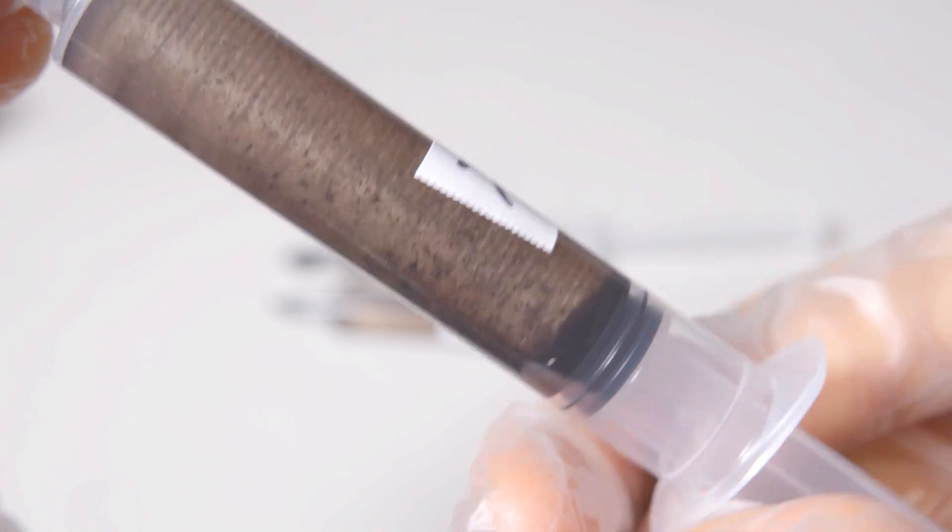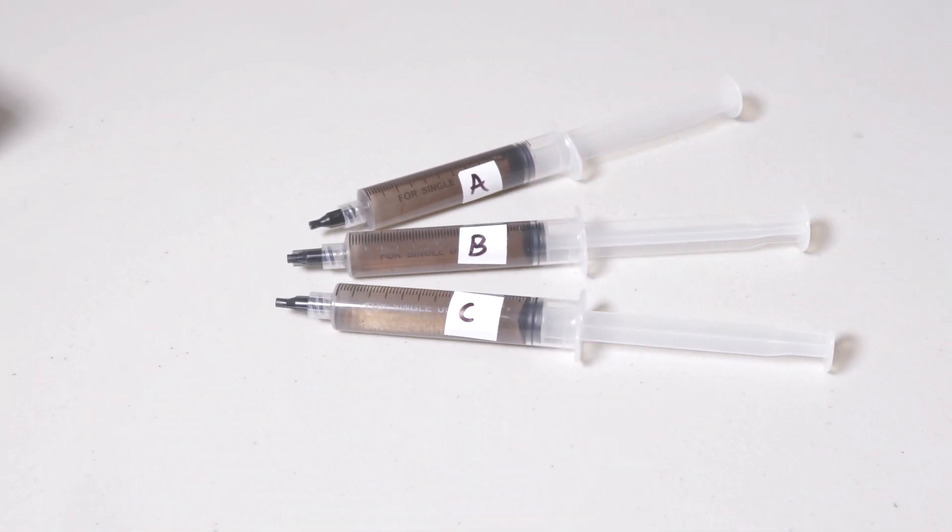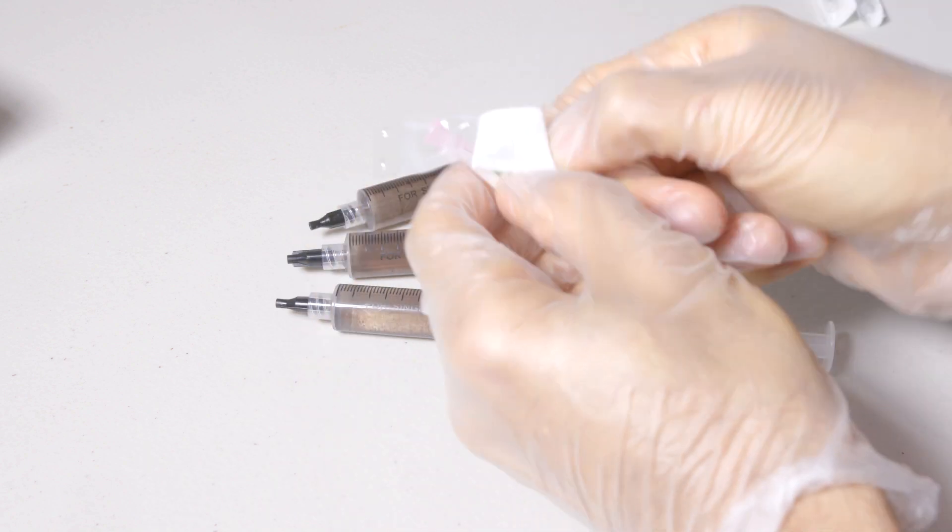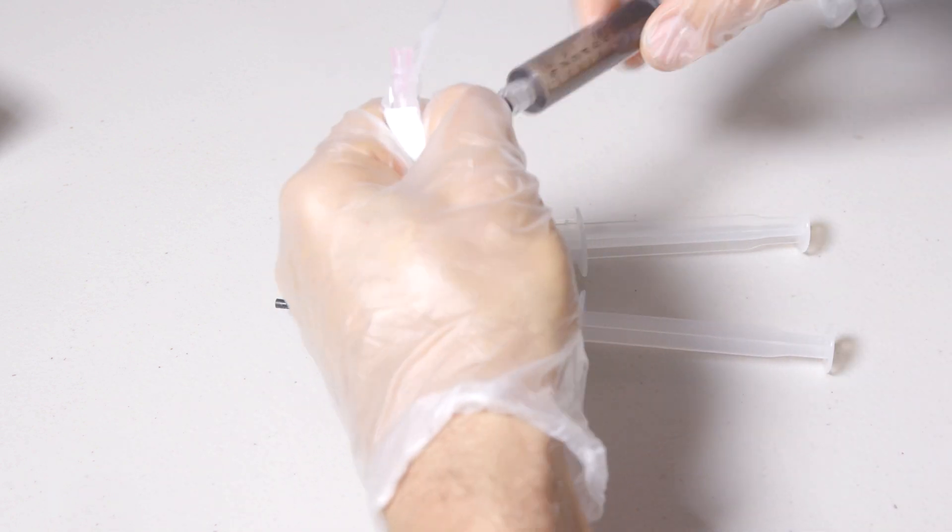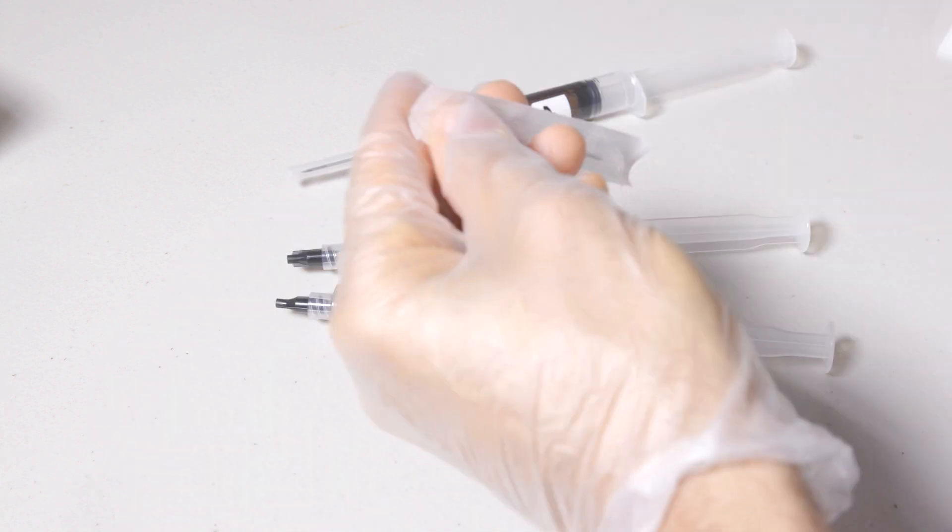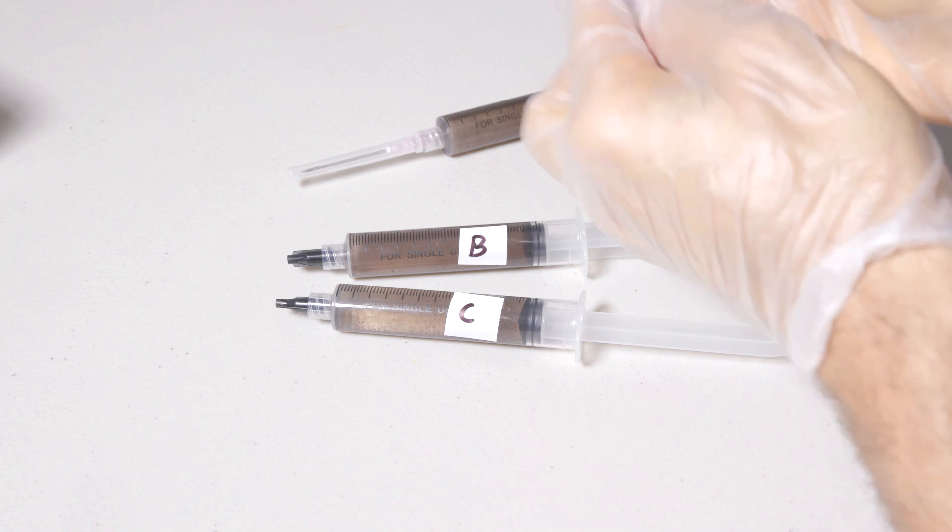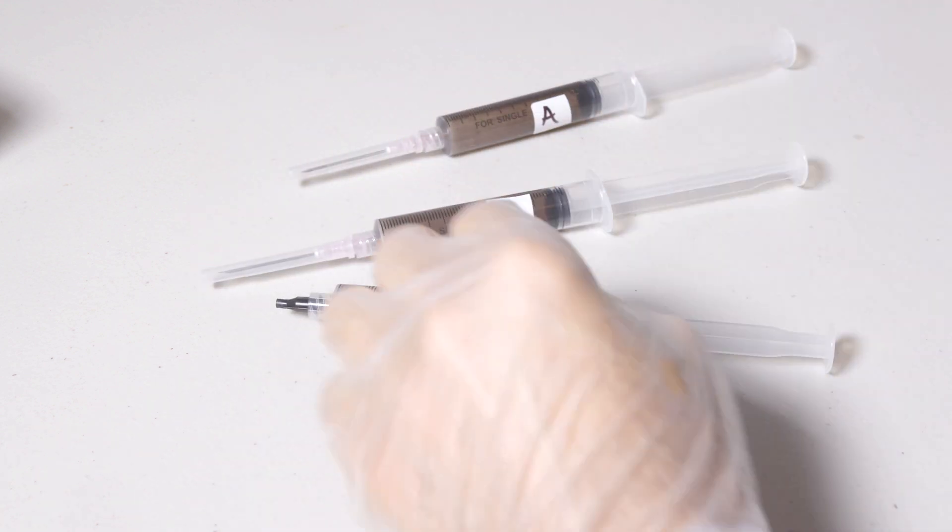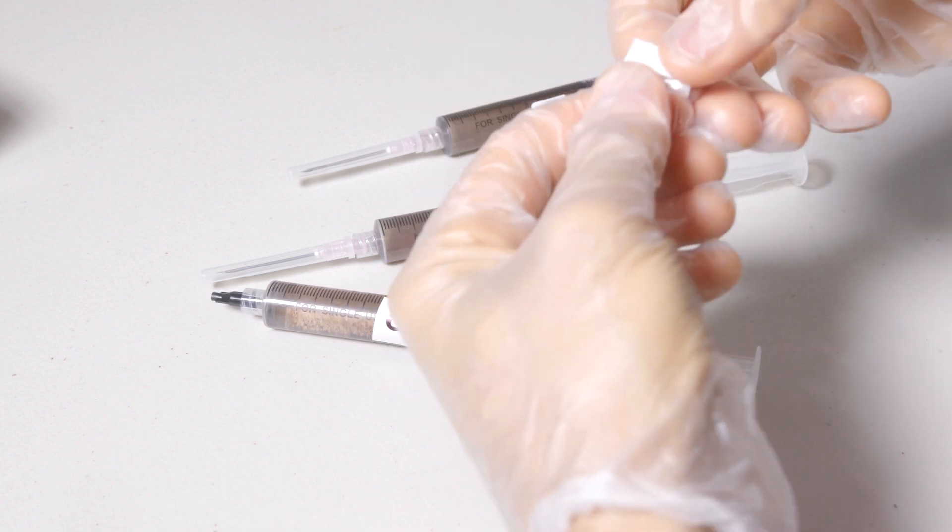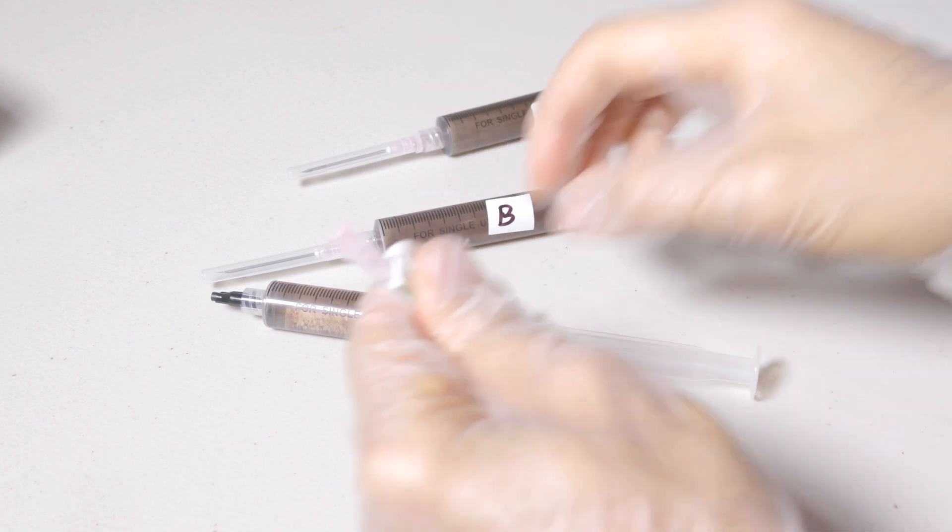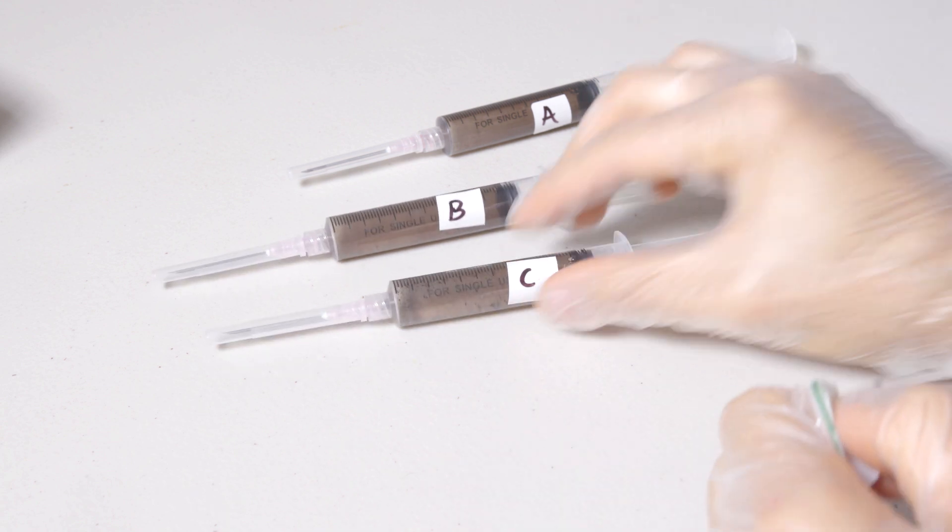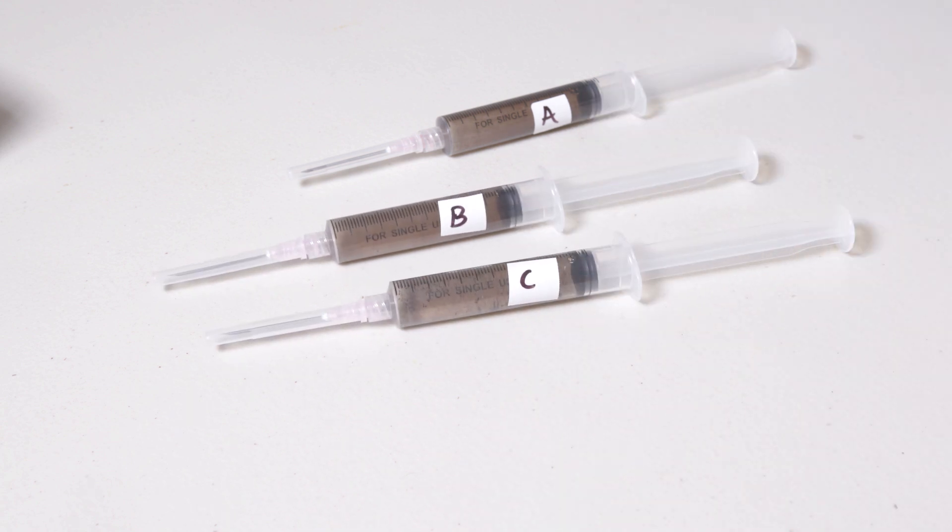Let's go ahead and get these spores onto some agar and have a look under the hood of these syringes. This test will show us what caused our initial grain bags to spoil and how the antibiotics were able to eliminate that contamination. Proper antibiotic use is considered safe because the amount of antibiotics used and the exposure time to them are so small that there's less chance for them to pass down the food chain. We simply want to use them when needed, then go right back to non-treated mediums for cultivation and culture storage.